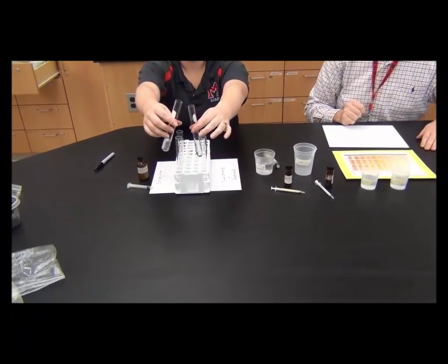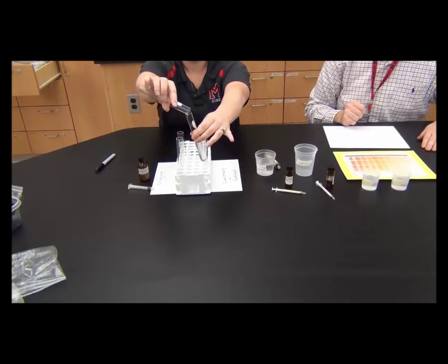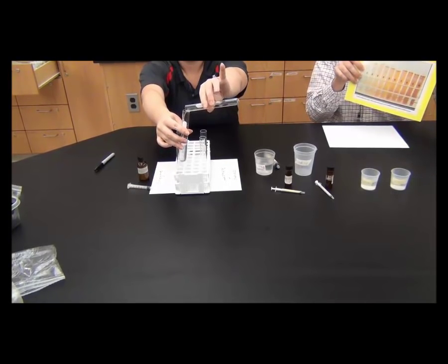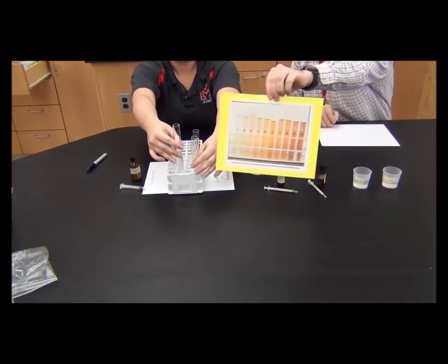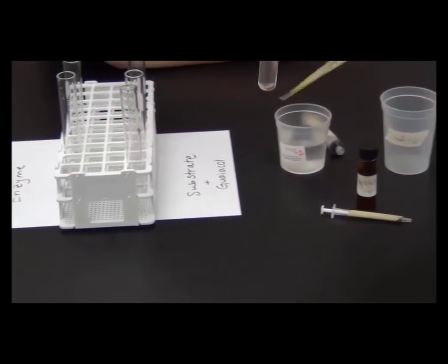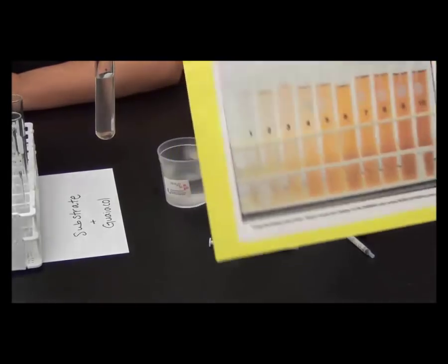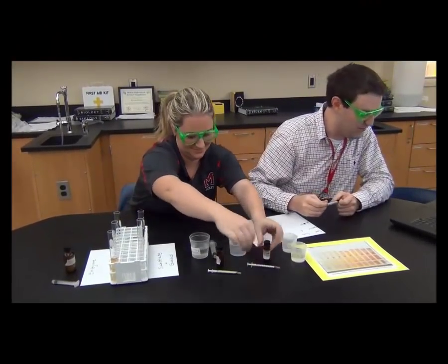Once you add all of your things to the correct test tubes, you're ready to mix them. As soon as you mix them, have somebody start their timer. Mix it a couple of times to make sure they're combined, and then you're ready to take your zero-minute reading. Just use the color chart and see what color matches up — probably very early on it's just a 1. Then you'll time it every minute and take the color reading again.